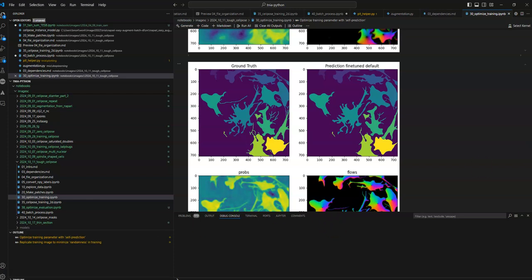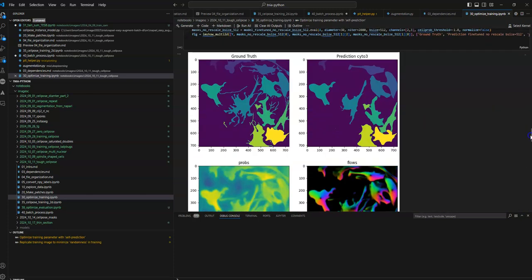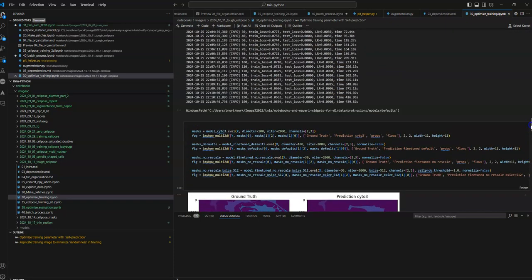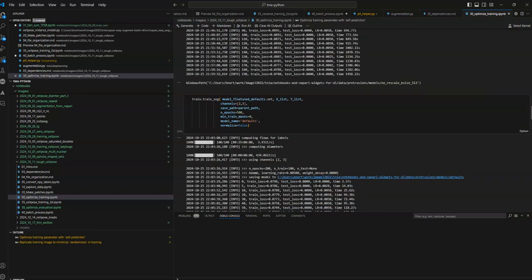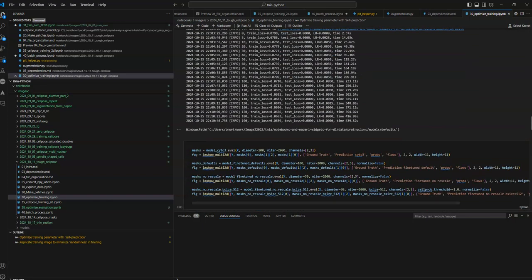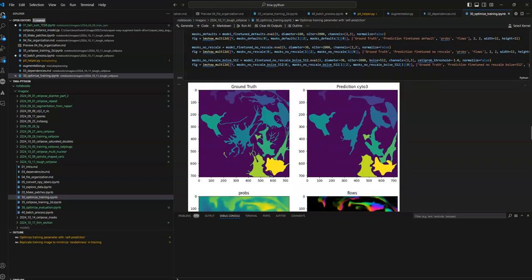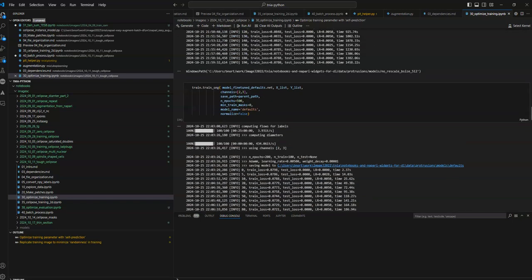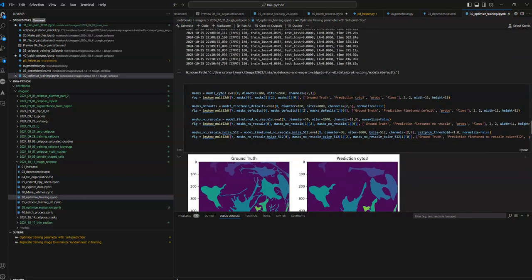There's a point which is still a little bit confusing to me. If you're following any of these videos, make sure you don't believe anything I say, and always get a second opinion, go to the forum. But what I've been finding is that when I train these networks with rescale equals false, so it doesn't rescale during training, then during prediction I always have to use diameter equals 30, which seems weird because obviously the diameter of these images is much bigger. So if you want to stop rescaling during training, you put in rescale equals false, and if you want to stop rescaling during evaluation, put diameter equals 30.